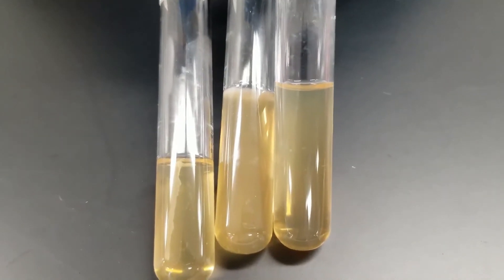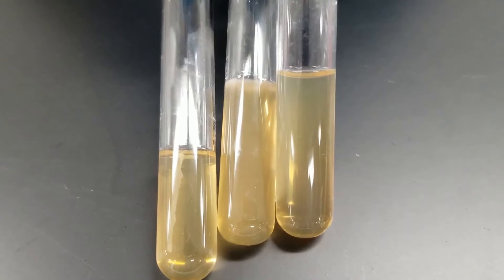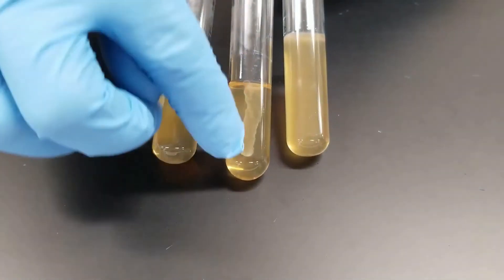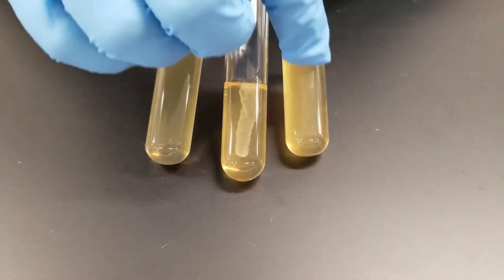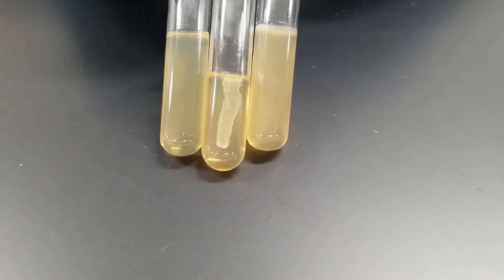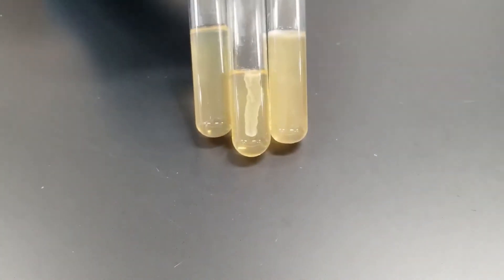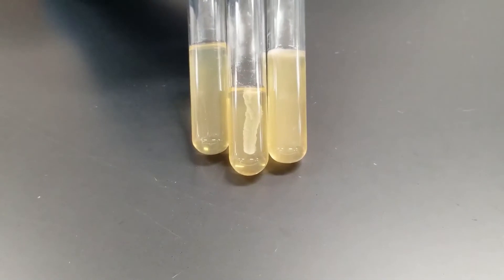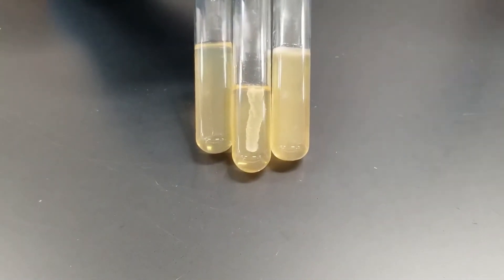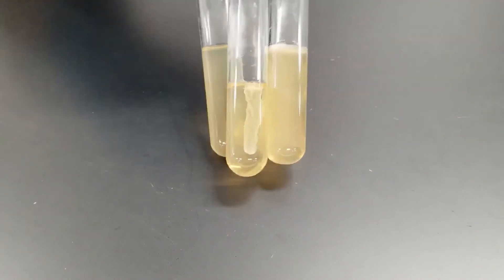The bacteria has grown throughout the entire medium. Compared to Staphylococcus aureus, which just stayed along the stab line, Enterobacter aerogenes was able to move throughout the entire media — that means it is motile. Staphylococcus aureus would be considered negative for motility. One of the main things we are looking for with this test is the production of hydrogen sulfide.